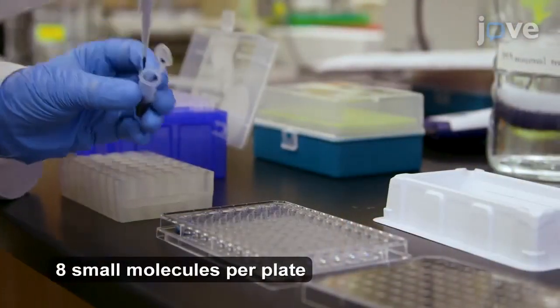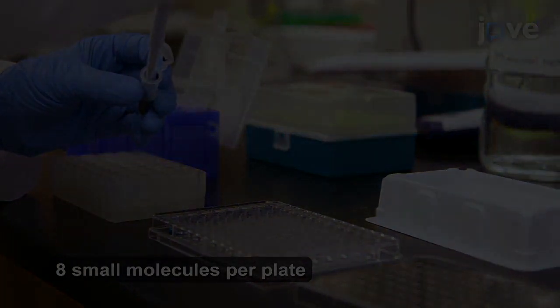Then add approximately 10 microliters of the concentrated small molecule solution to the column.